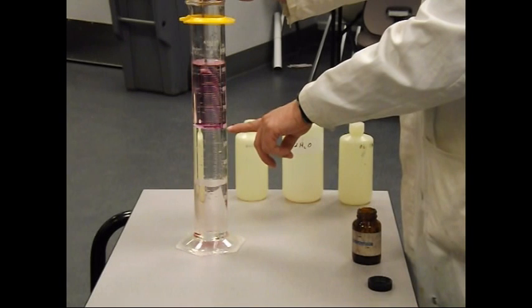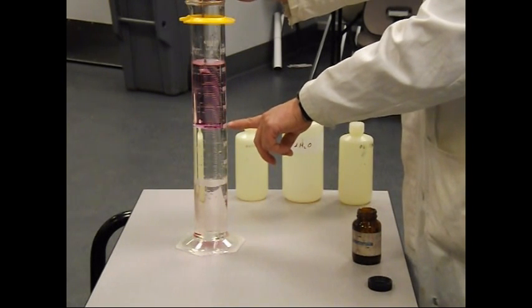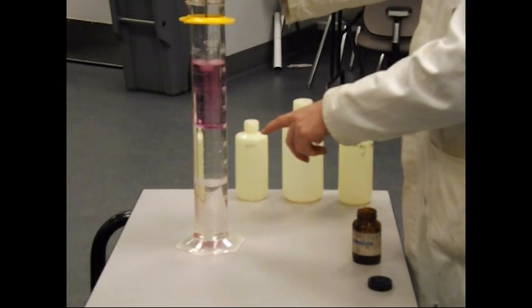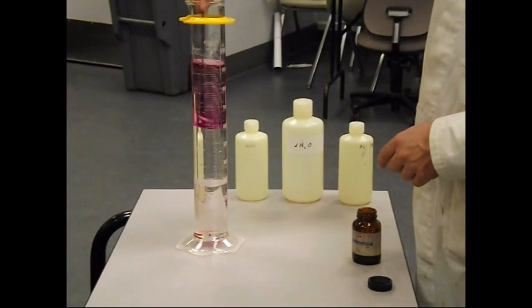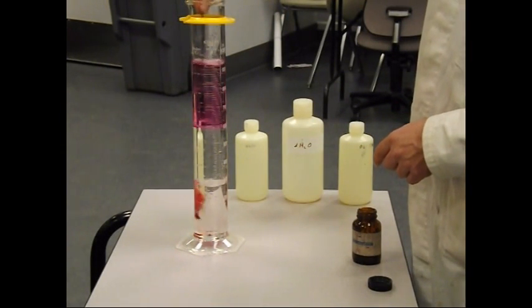Which is interesting to me because iodine is more dense than liquid water. But I'm just going to get those crystals to go through, and then I can disrupt them down here. And then they all go through.